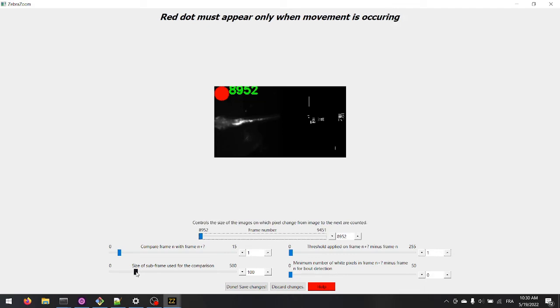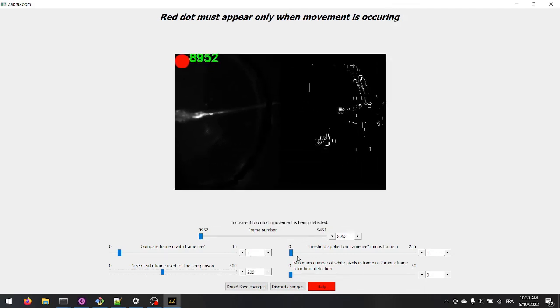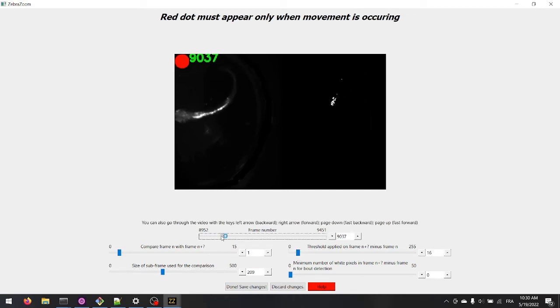Choose the size of the sub-video to be centered on the fish and only on the fish. We detect movements by subtracting subsequent images and by counting the number of pixels above a certain threshold. First, adjust this threshold. To check that the red dot appears at the right times, use the cursor or the page up, page down for fast forward or the arrows of the keyboard to inspect each frame. Set the minimum number of white pixels to a value slightly higher than 0.